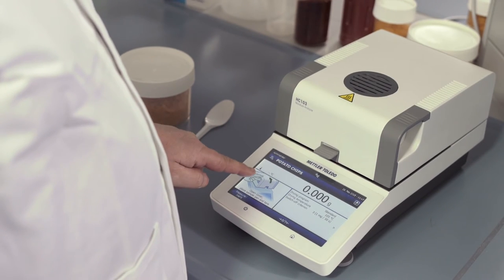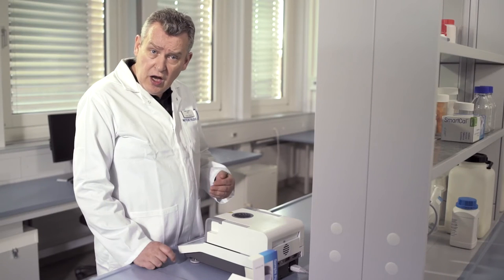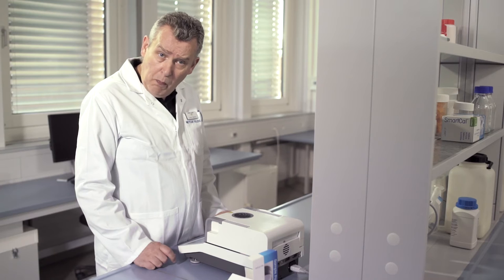On the left, you can see the user guidance, which will guide you through the whole measurement process.